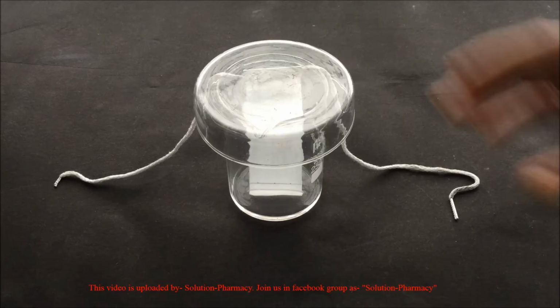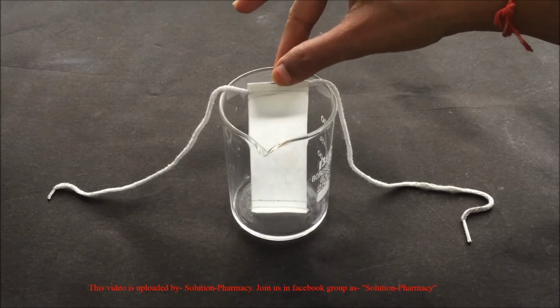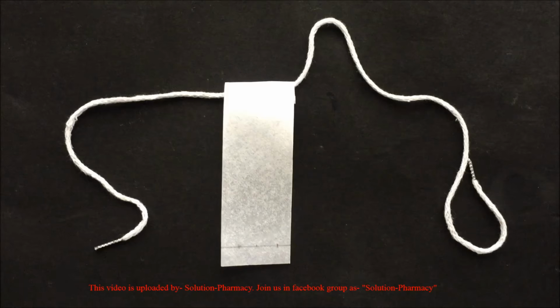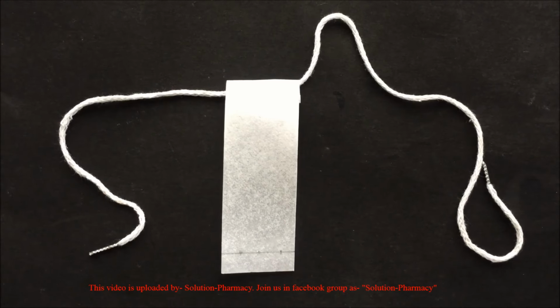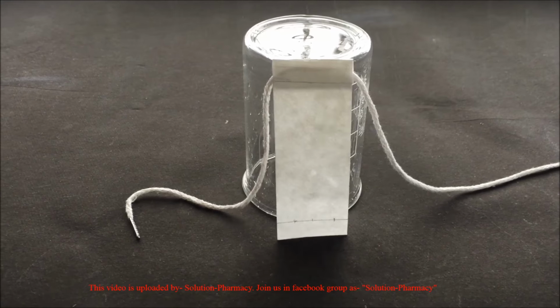When the solvent touches the end line at the top of the filter paper, take the paper out of the beaker, mark the solvent front with a pencil, and then allow the filter paper to dry at room temperature. You can see that the spots of amino acids are not visible. So after drying the filter paper at room temperature, spray it with ninhydrin reagent to detect the spots of amino acids.